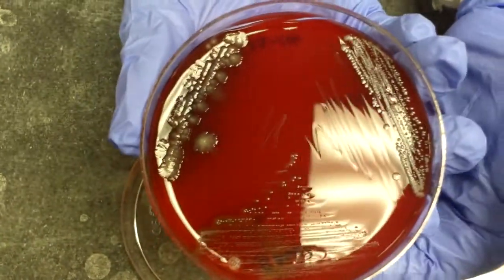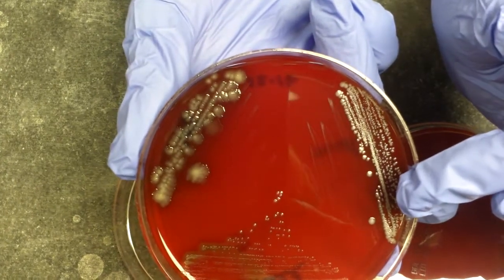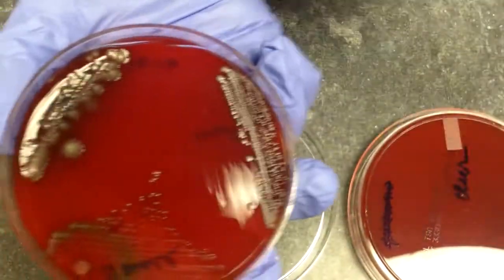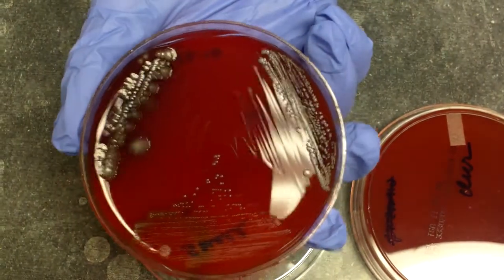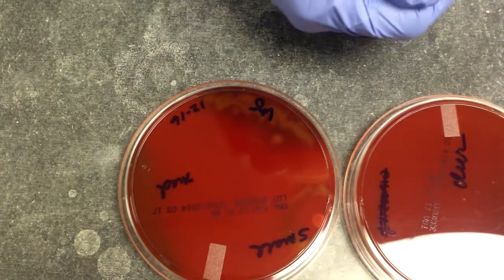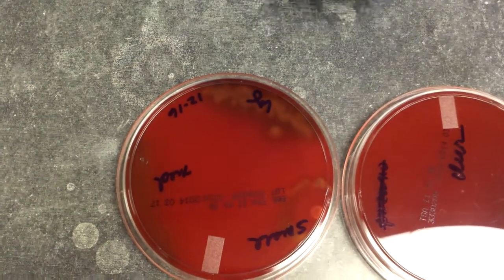The plate with, I'm going to call it group B strep, has small colonies, medium-sized colonies of Staph aureus, and large colonies of E. coli. Generally speaking, our streps are pinpoint to small. Our staph, such as Staph aureus, Staph epi, Staph saprophyticus, are in the medium size, and gram-negative bacilli like E. coli, Pseudomonas, are generally larger colonies.